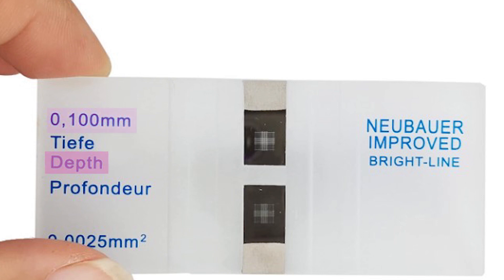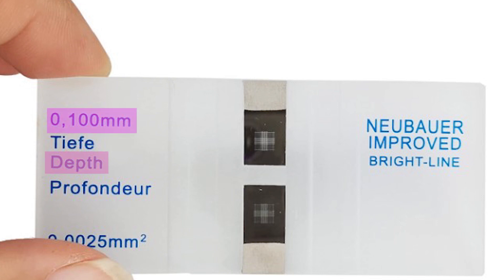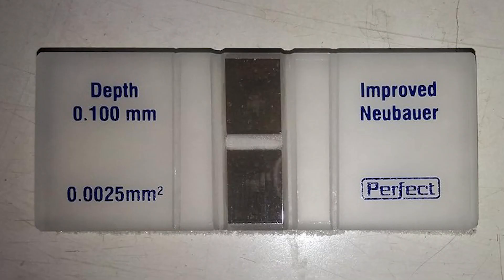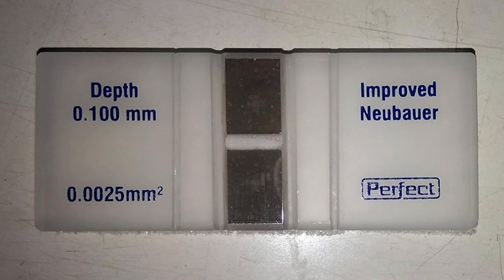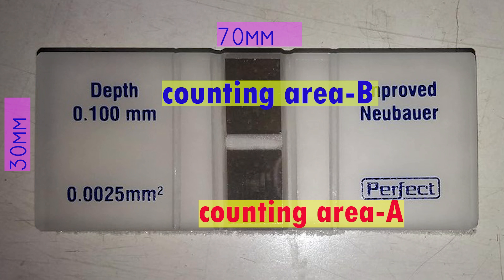The number of cells in CSF is counted using a Neubauer counting chamber. It is a thick crystal slide the size of a glass slide — 30 x 70 mm and 4 mm thickness.